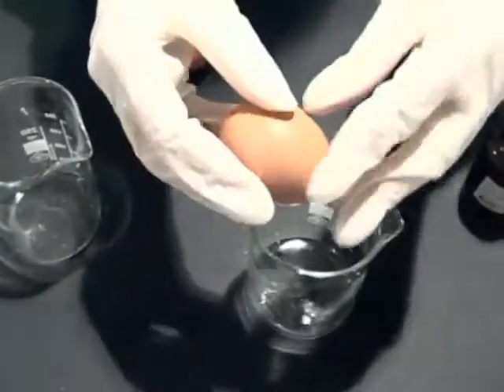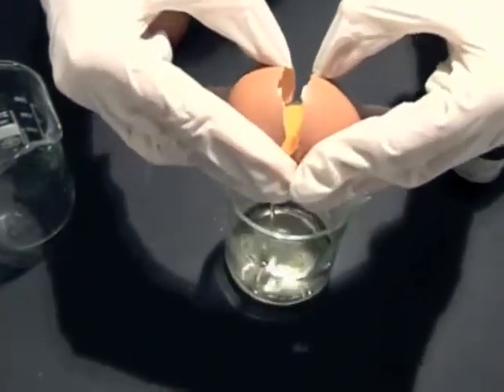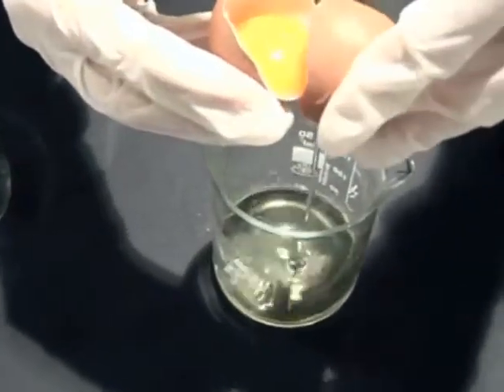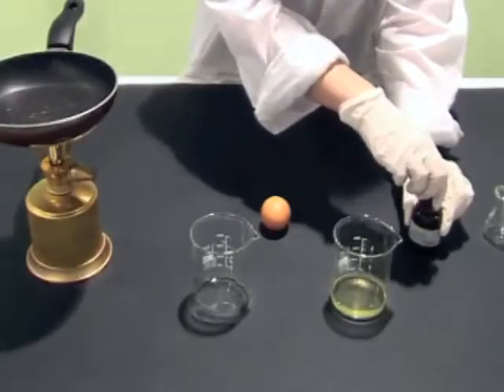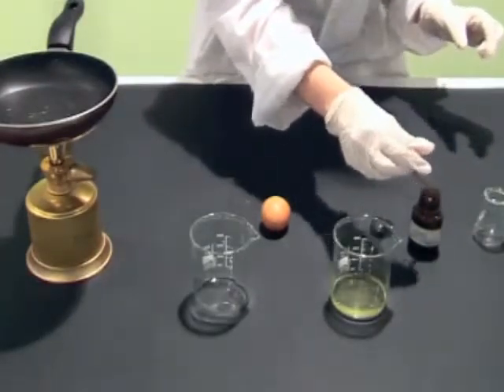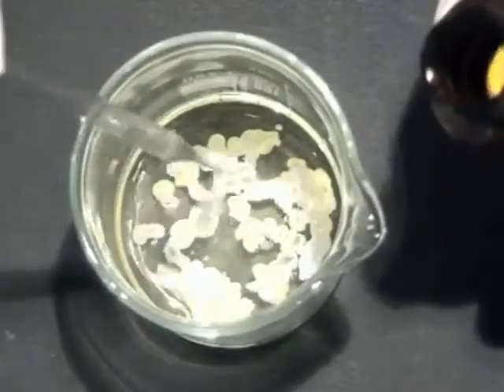We crack the egg and keep its white. We add hydrochloric acid. We observe that the transparent egg white becomes white and insoluble.